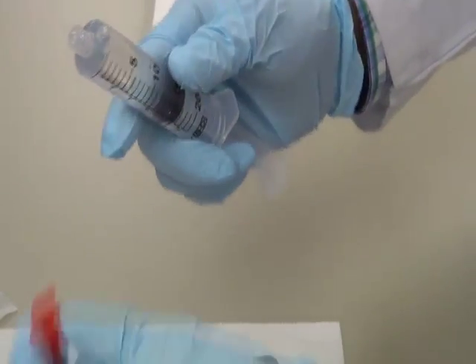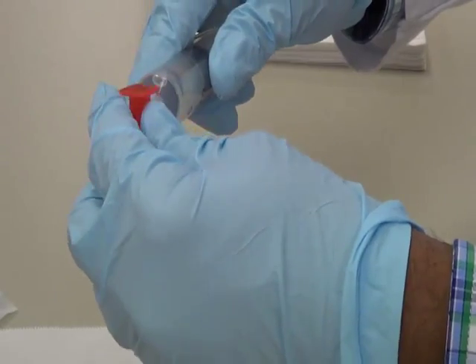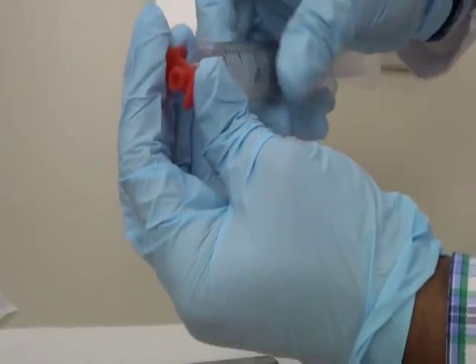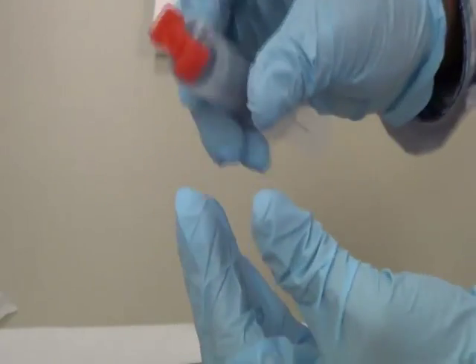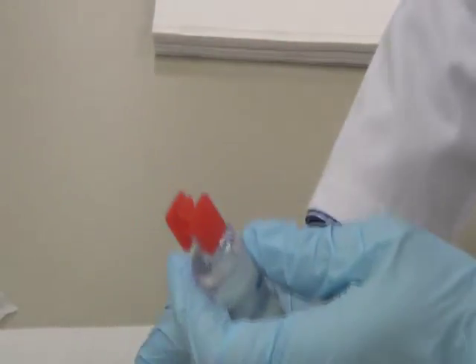So the next step is I am going to connect the Luer tip. I am going to connect this with the Luer tip. This is how you connect this Luer tip.